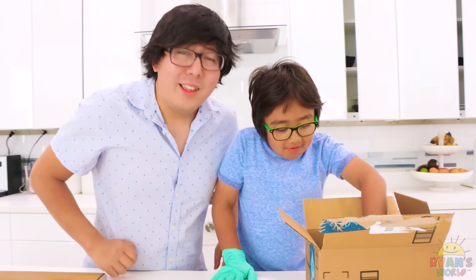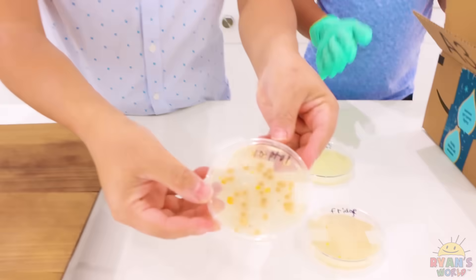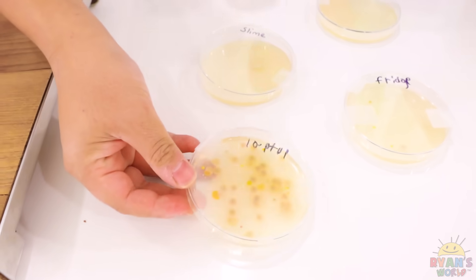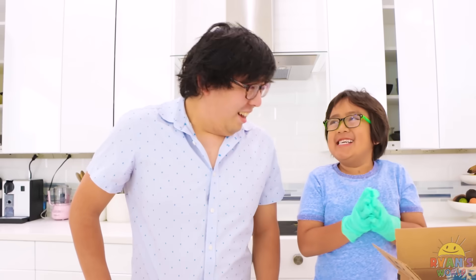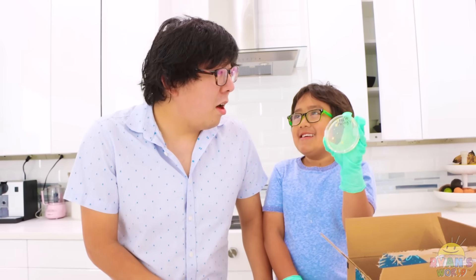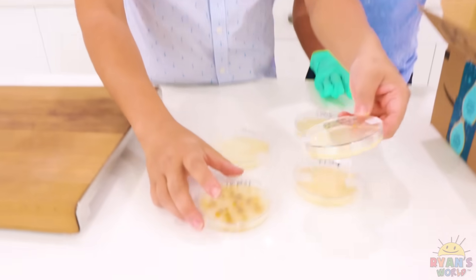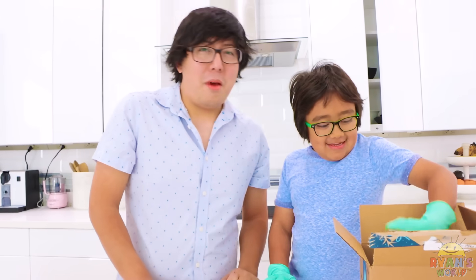Let's pick up some bad ones. What is this — that's your laptop? Oh my gosh. You better wash your hands after you use your laptop, or you need to clean your laptop too. Look at that! I didn't know I've been touching it. Now I know — I should clean my laptop every day too. Soccer ball — compared to my laptop, it's much cleaner. I'm embarrassed.